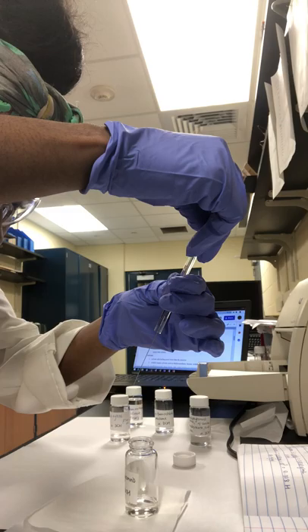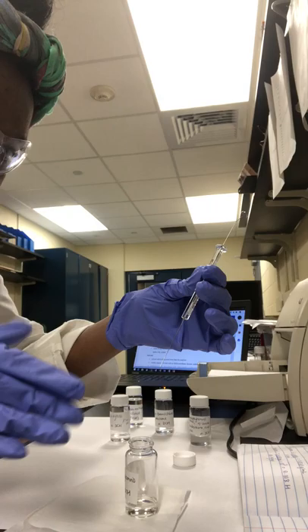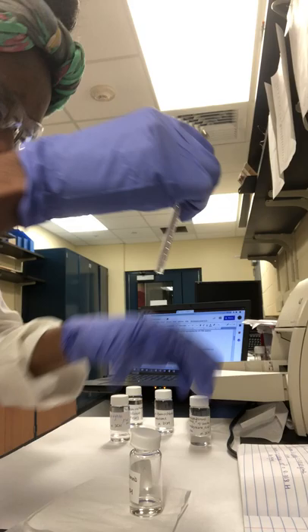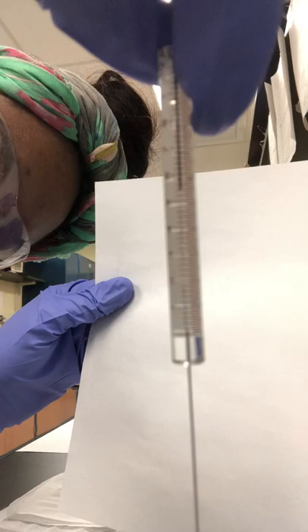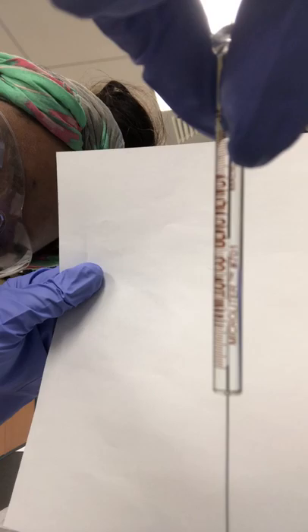That is about one microliter. Now we're going to pull up another pocket of air after this sample. This second pocket of air is to avoid premature expulsion of our sample into the injection port before we're ready. As you can see, our syringe has sample loaded in it with pockets of air on either side. Your syringe is now ready for injection of the sample into the GC-MS injection port.